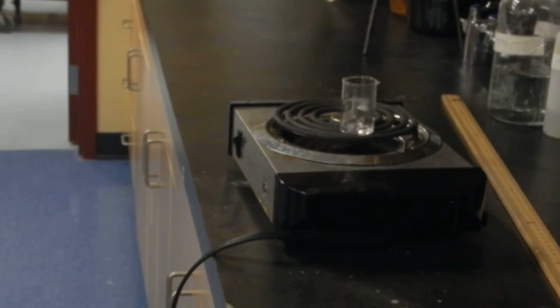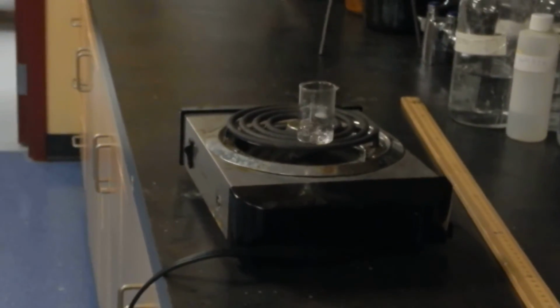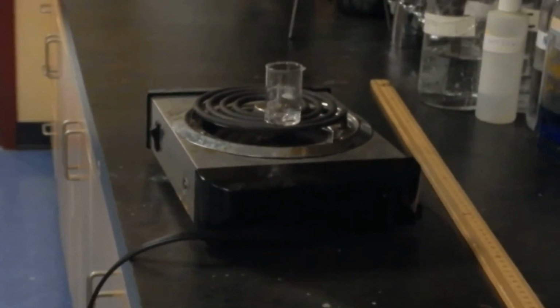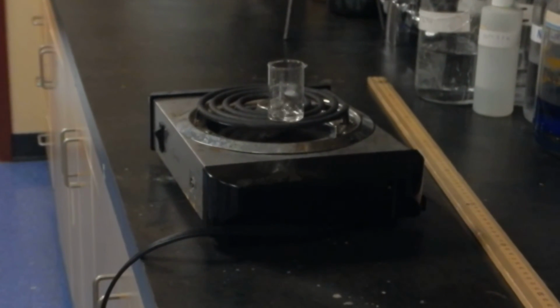So, how much liquid would you estimate is left? Like 4 milliliters. Oh no, it's going to take days. Fortunately, if you're watching this video, you have nothing but time on your hands.